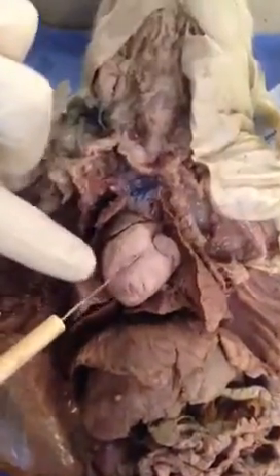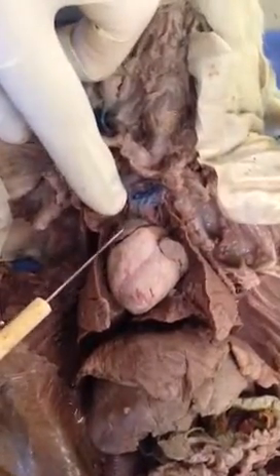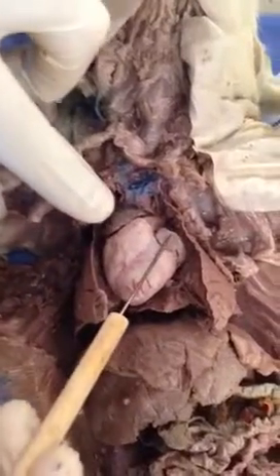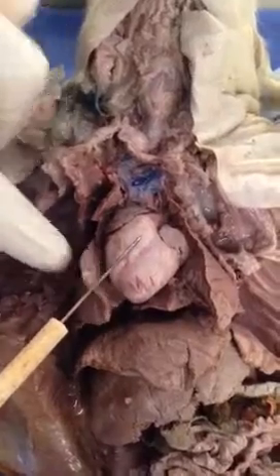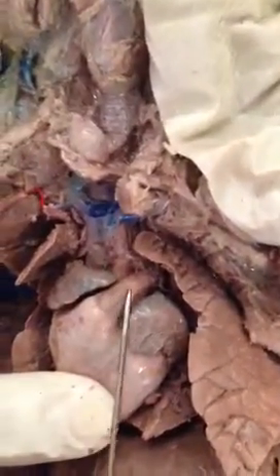And then we have the lungs around the heart, and we have the four-chamber heart. We got the right atria and the left atria, the left ventricle and the right ventricle. We have the pulmonary trunk right here — this thing is the pulmonary trunk.